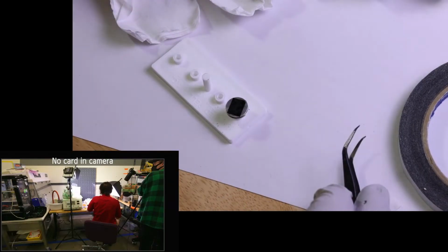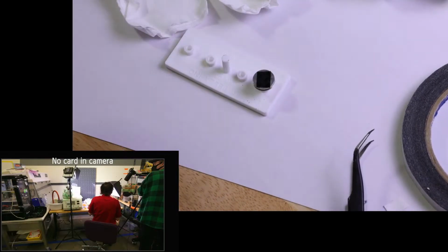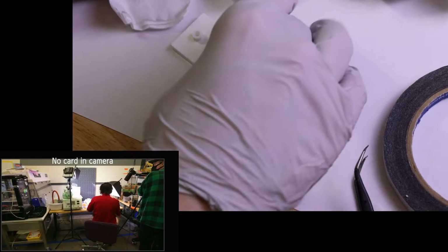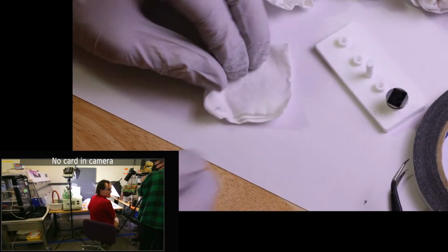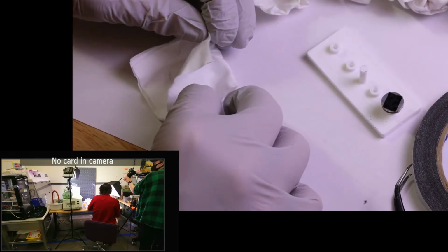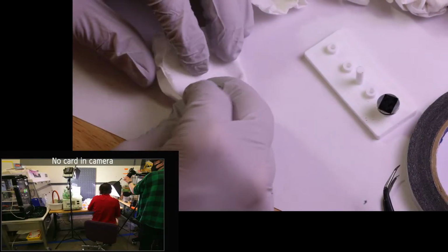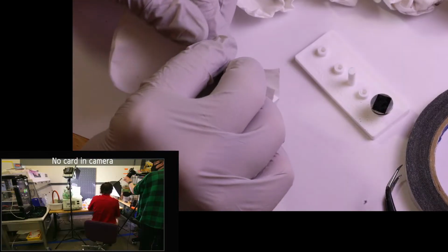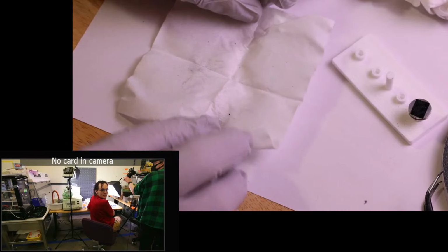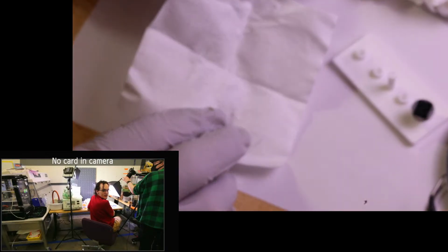Okay. Are these the conductive ones or are these not? I hope they are. Because the advantage of these ones is these are very, very smooth. We'll go with what we know is gonna work. So now we're going to go ahead and unfold our first thing we wiped the chamber out with. I don't know how clearly it's coming across on camera, but I can definitely see like a lot of little glints of metal.